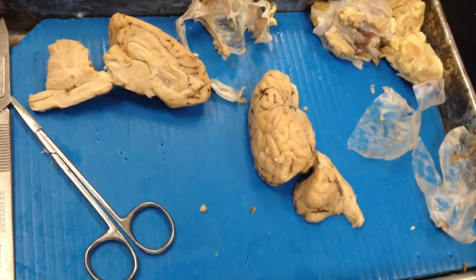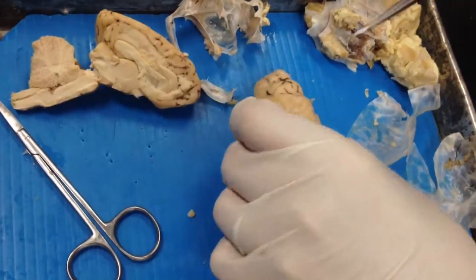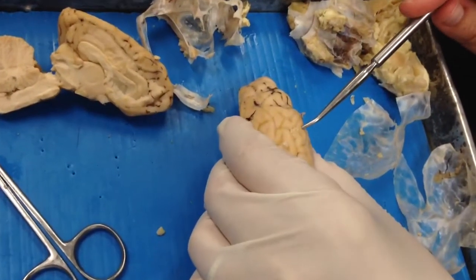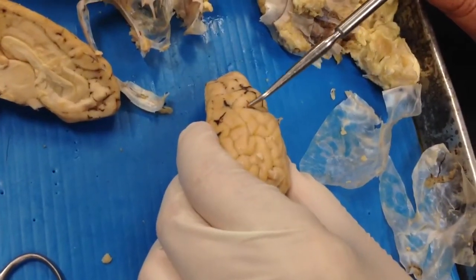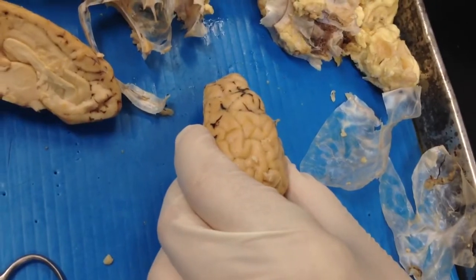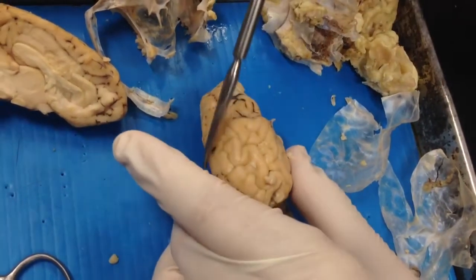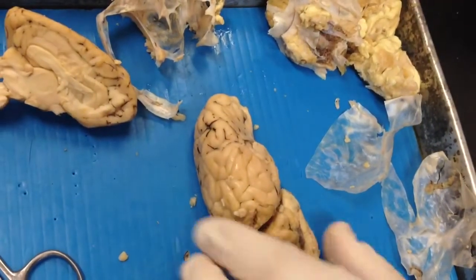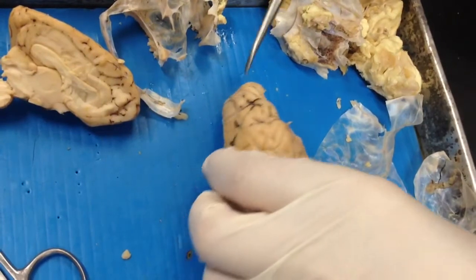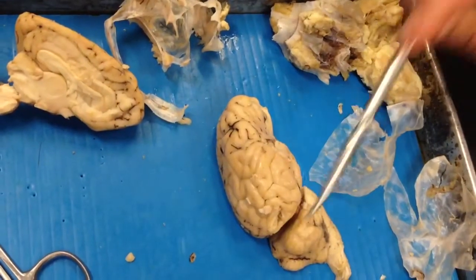The gyri and sulci: gyri are the hills and the sulci are the little grooves. And the fissure is the deep groove. We have two: longitudinal and transverse.